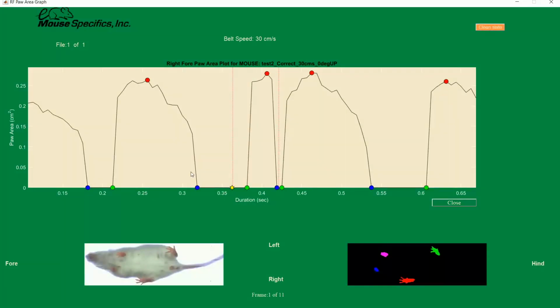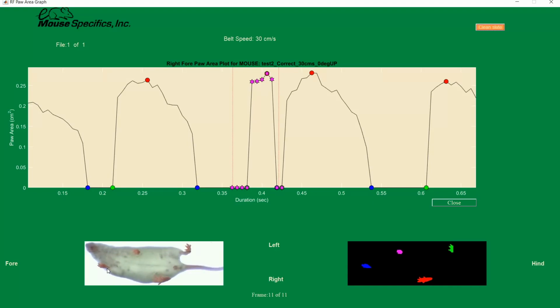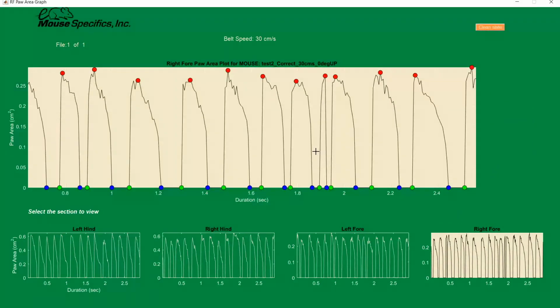The software here identified the right forepaw as being in stance phase, but the raw video tells us that the right forepaw was in swing phase. Playing this back again, we can see that this was a mistake and that we'll want to use the correct button to edit it. Before editing, though, we'll want to use the play video button on the other section of noise. It's important to use the play video button on anything you want to look at in your video before moving on to making the edits.